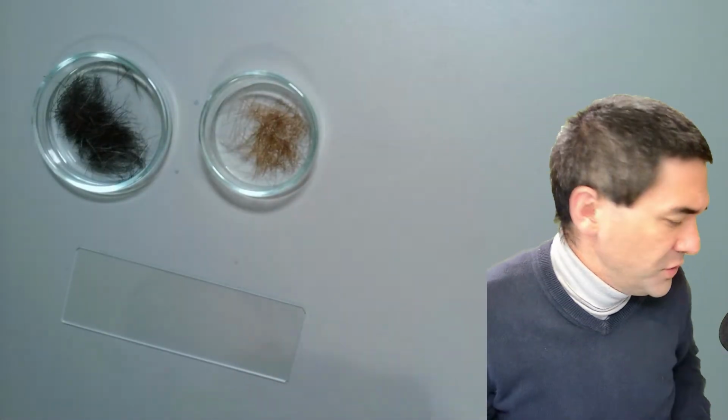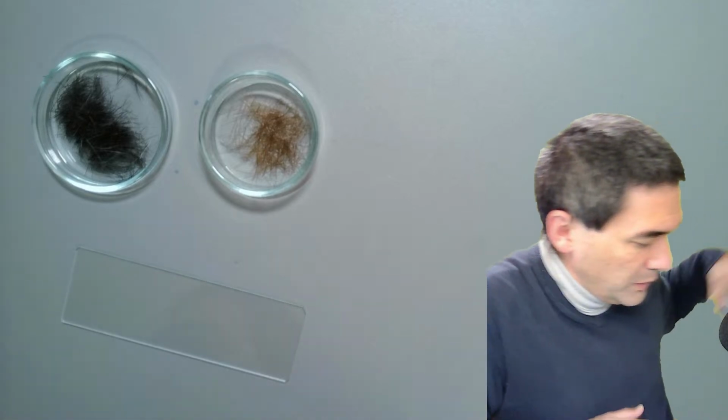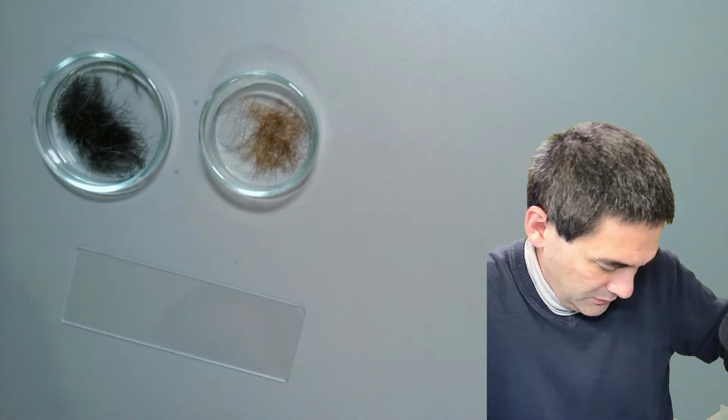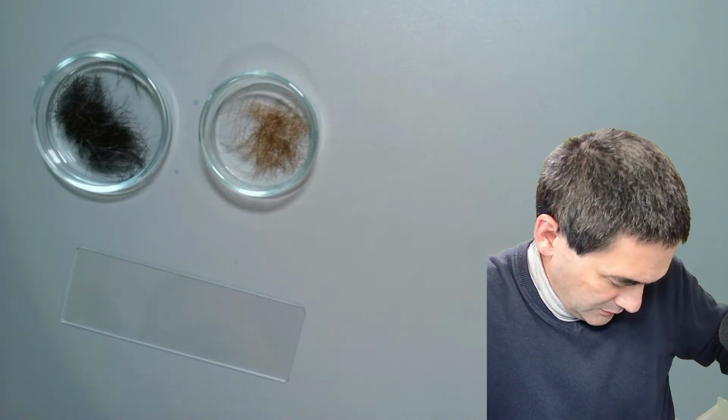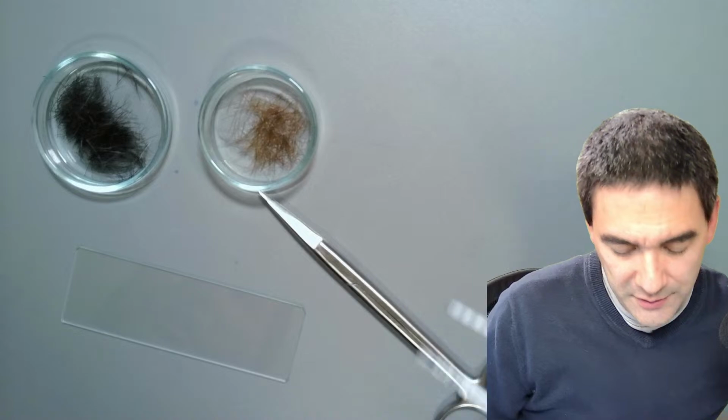I need some tweezers. Where are my tweezers? Where are my tools? Here they are. Where are my tools? It's a little bit easier to take out the hair.